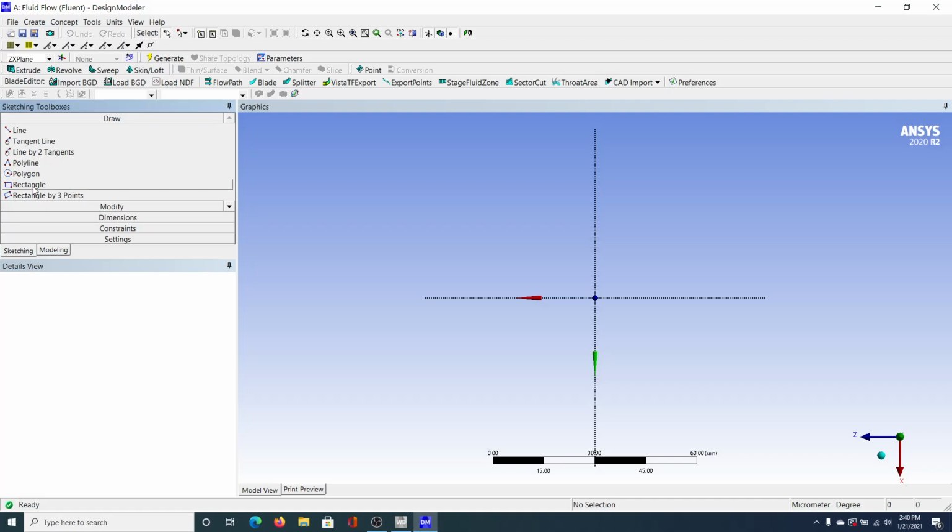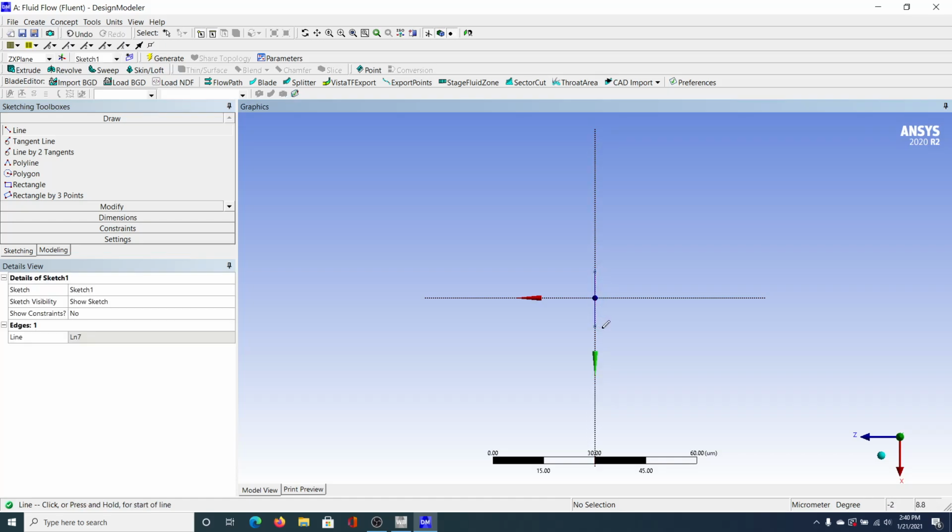So we're going to go to sketching and line. Now we're basically going to start creating lines. I'm going to create this first line that passes through the origin. And you just click once to start the line, click again to end it. So I'm going to click. And you can see this little symbol that's below the line. You click that, it's going to snap to be parallel with whatever line you're running next to. Okay, so we're going to create and snap it.